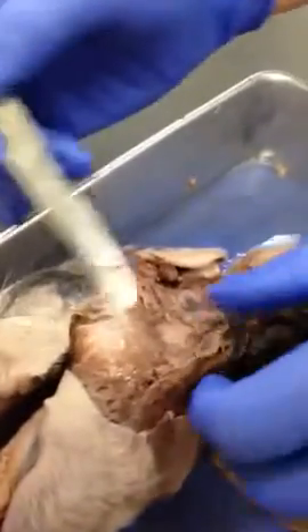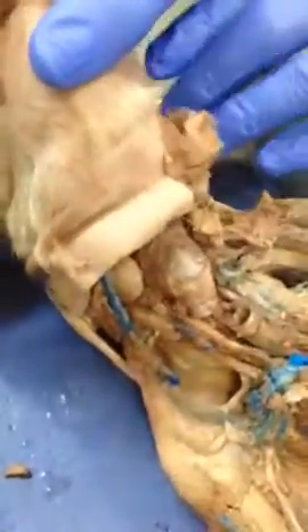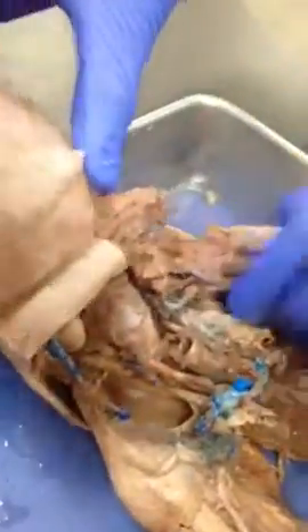We just removed this flap of skin to uncover the facial nerve and the jaw muscles. As you can see here, it looks like on the picture — you can see the outline of the lymph node right here, which if you open underneath, you see right here. So you can see the outline of that.